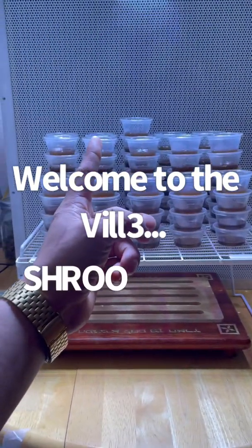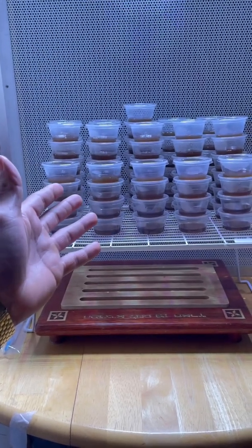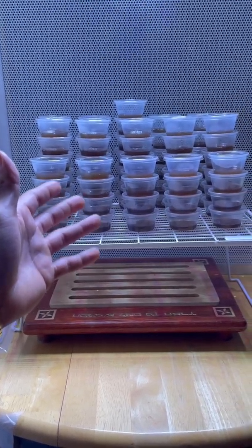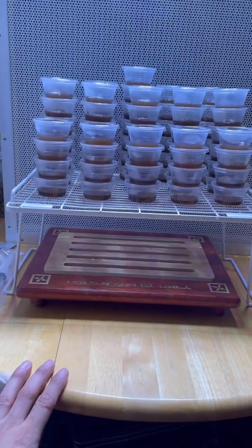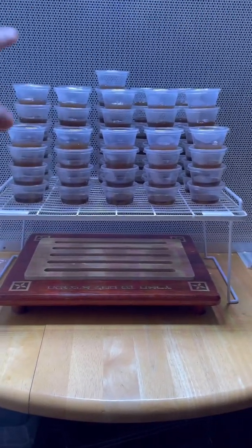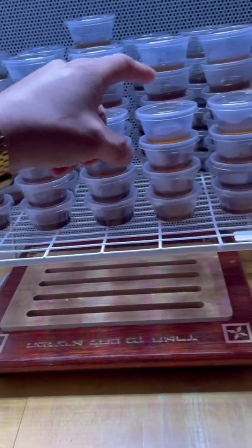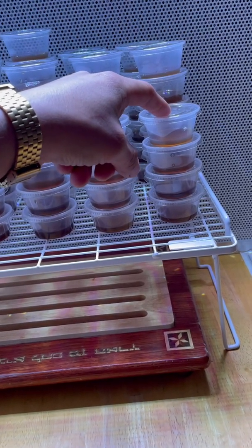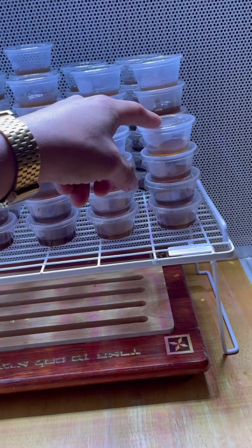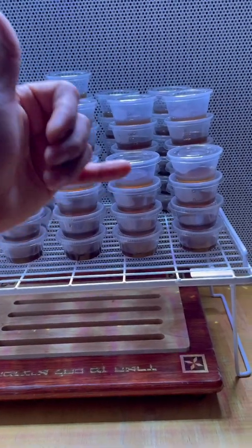One more thing. You want to have less condensation? When you're pouring your agar cups, stack them. Usually the last one on top will have the most condensation. This is something that I learned from Michael Madness. Shout outs to my boy.